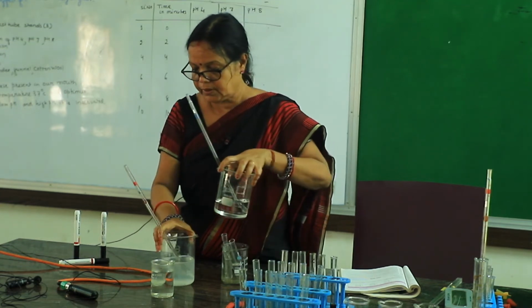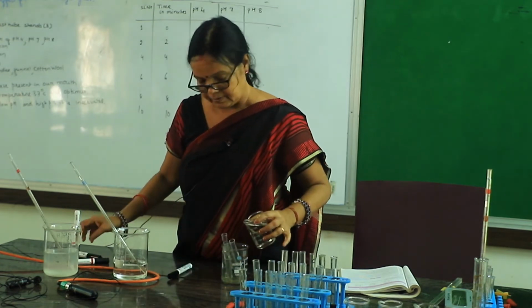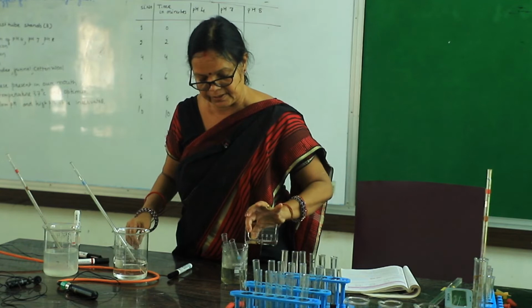This work is over. Next you have to take a water bath. The temperature you have to maintain is 37 degrees centigrade.